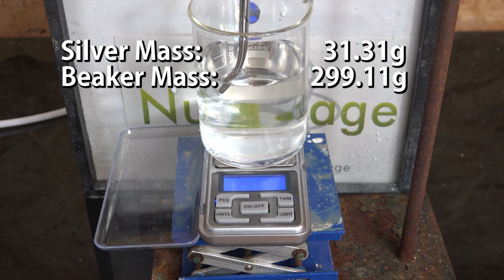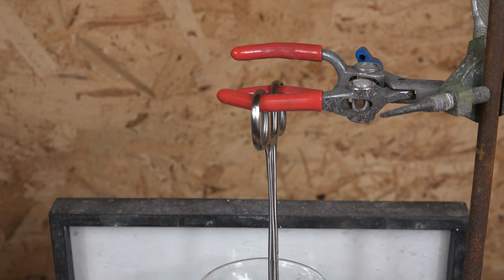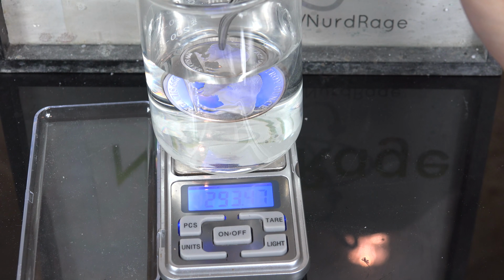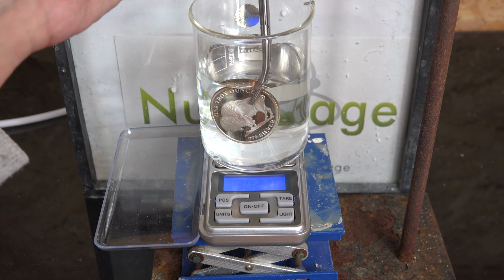And then I record the mass of the beaker of water. This is the calibration. To improve the calibration, I'm also suspending the forceps from a rigid clamp stand. This is to eliminate errors from my jittering hand. Now I hold the silver round to the same depth and record the new mass.